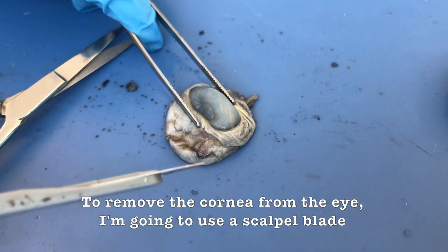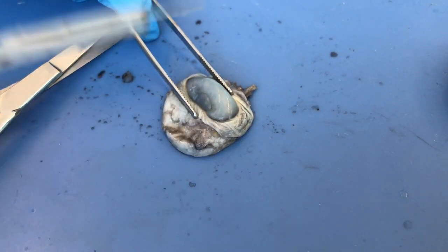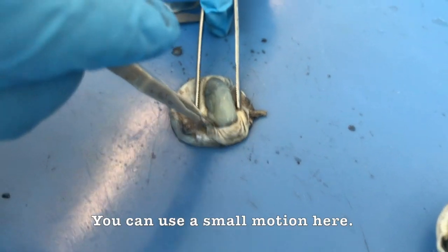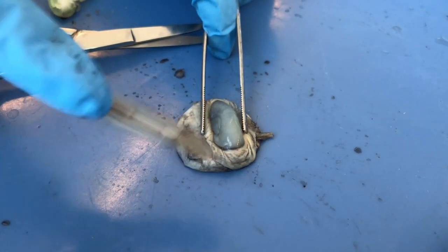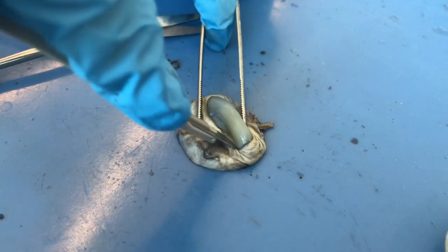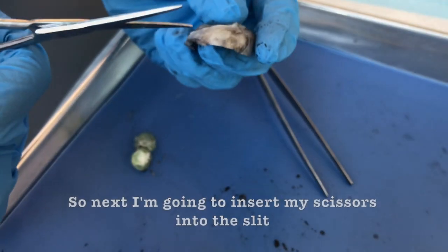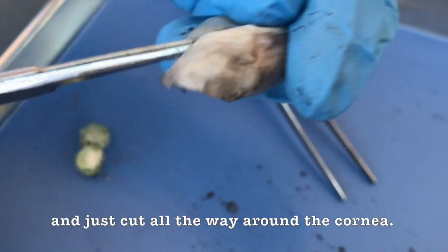To remove the cornea from the eye, I'm going to use the scalpel blade to puncture a small slit at the junction between the cornea and the sclera. You want to be gentle here because you will feel a give when you have punctured through. You can use a small motion here. And now you can see that we have gone through. So next I'm going to insert my scissors into the slit and just cut all the way around the cornea.